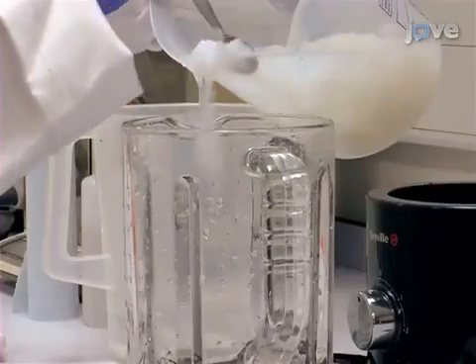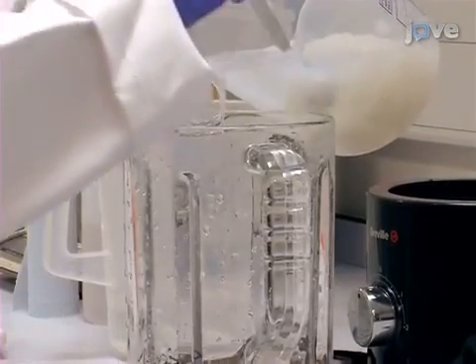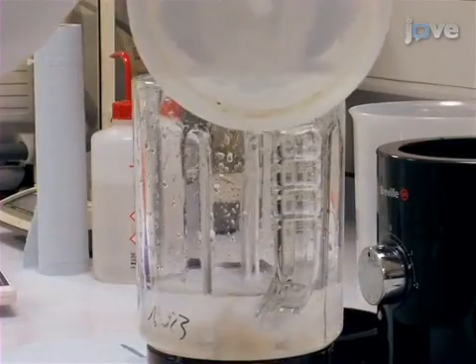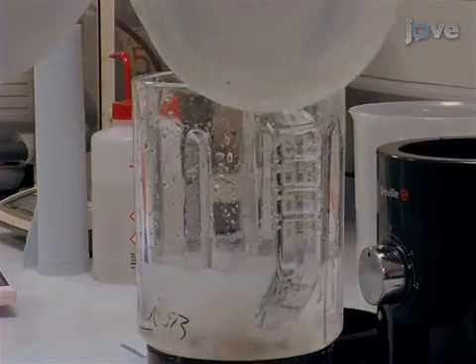Feed the cut bacterial cellulose pellicles into a blender and add 300 to 500 milliliters of water so that the blending process goes smoothly.